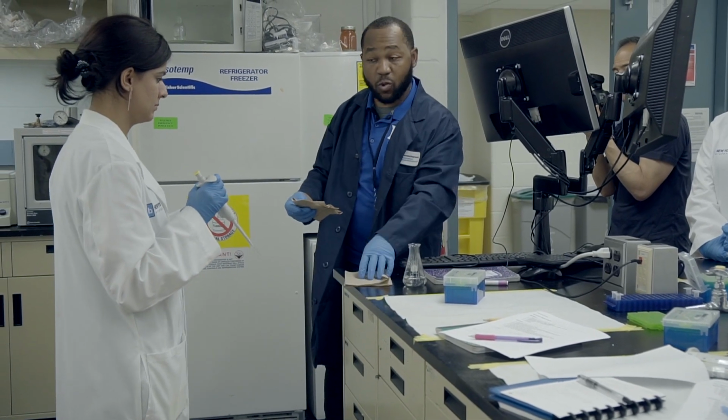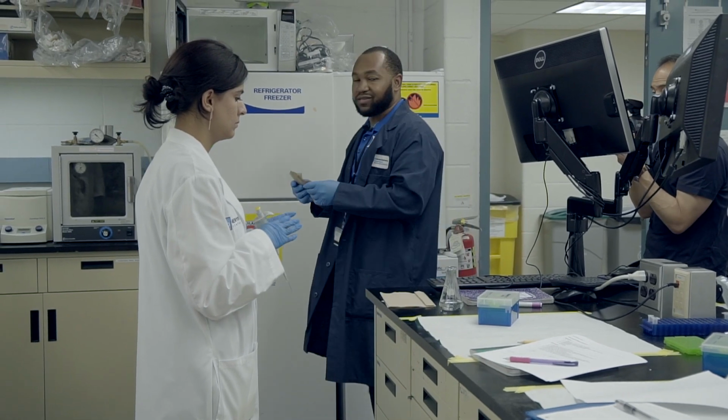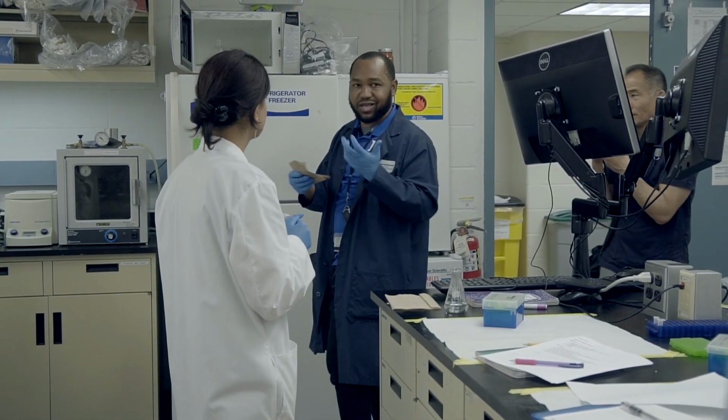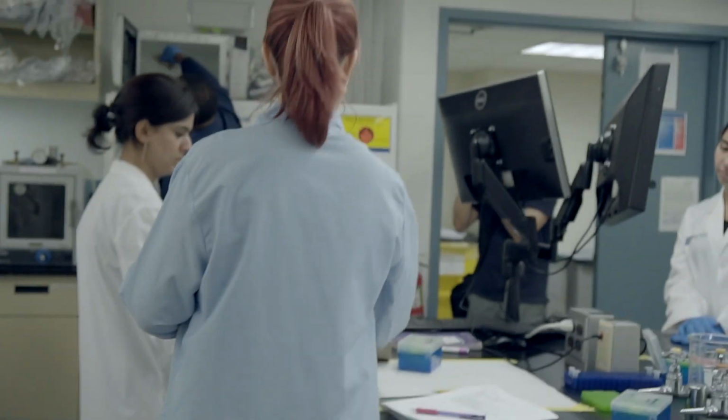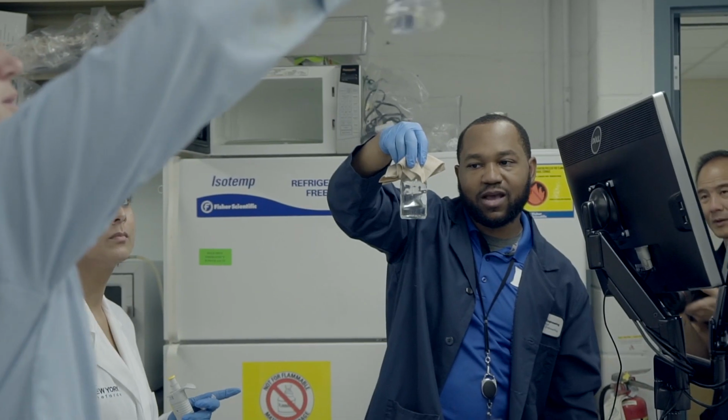So I had to heat this up twice, but it is now relatively clear. However, it's also very hot. Sometimes you have hot gloves. Paper towels kind of work okay as far as insulating. And you can kind of see now it looks a little bit thicker. It's not quite too liquidy.